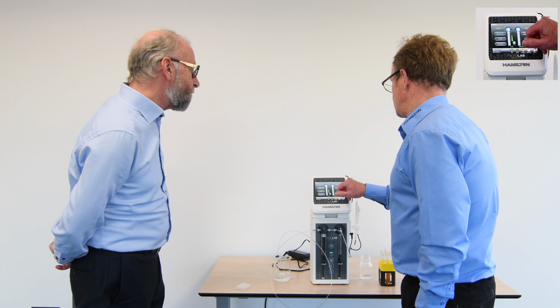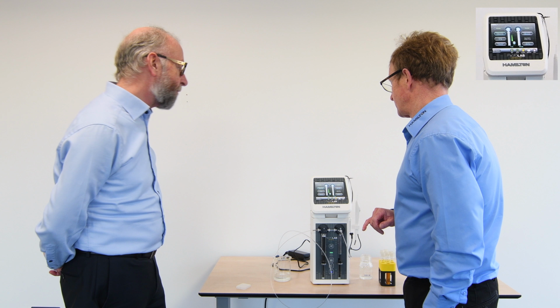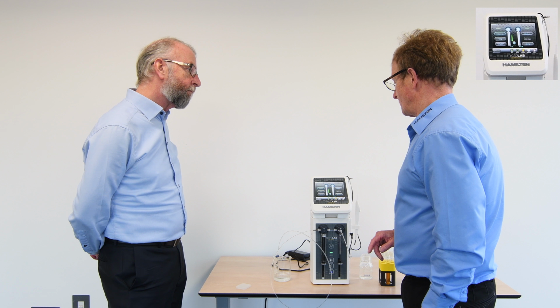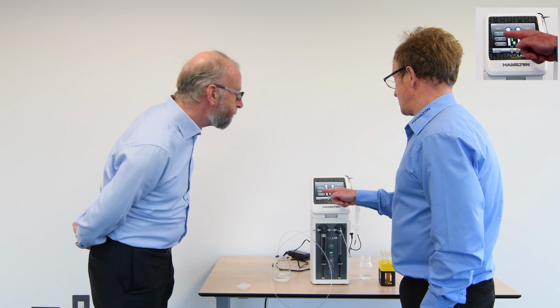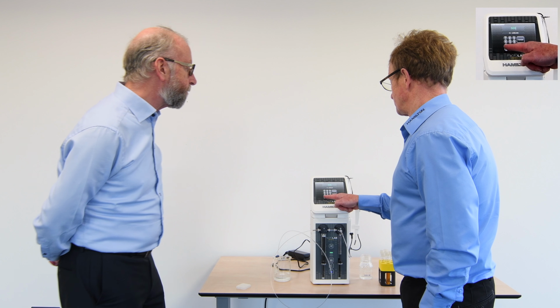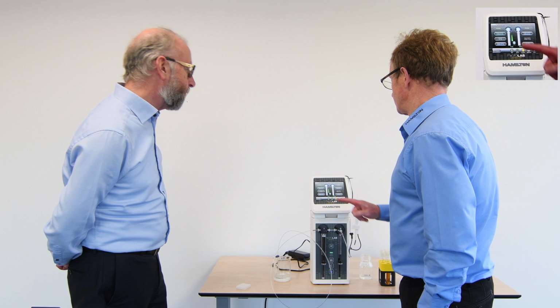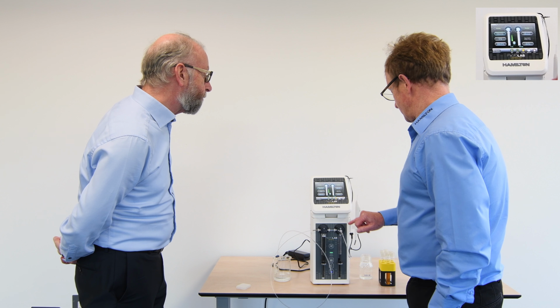You can see that it's corrected and shown that we have 500 microlitres of sample and 1500 microlitres of diluent. I may want to increase my volume of wash to, let's say, 5 mils. I could easily do that by putting a wash step of 5,000 microlitres, whatever volume we think is appropriate for the diluent. So here you can see all the variables have now been changed. And we're going to conduct the same sort of program as we had before.